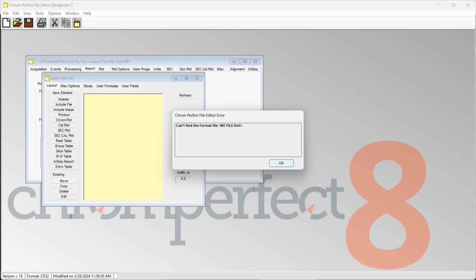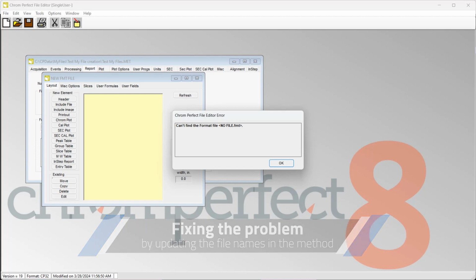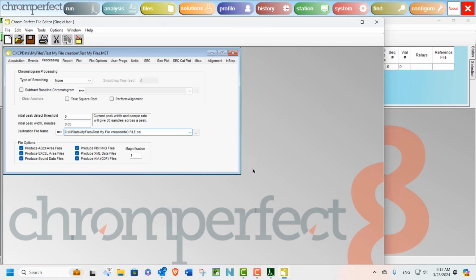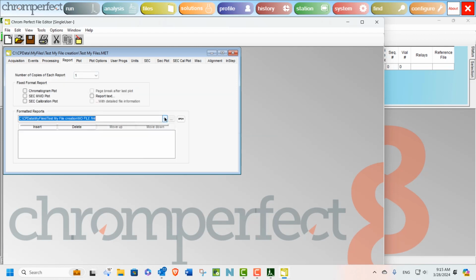This can be a common problem if somebody accidentally deletes or moves files to a new directory. Of course, the fix is very straightforward, and we just need to select the calibration and report files we looked at previously, which include the options to produce auxiliary files. Using either the pull-down recent file list or browsing for the directory, we will select the correct files.